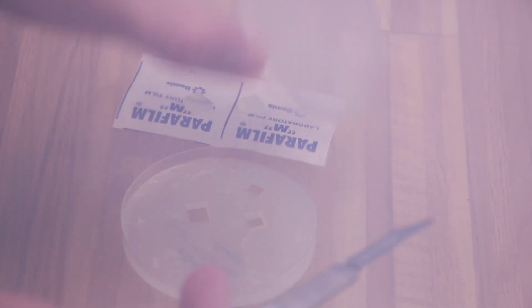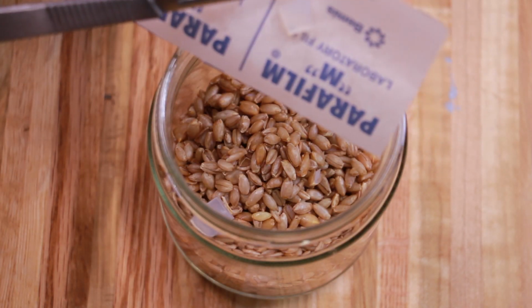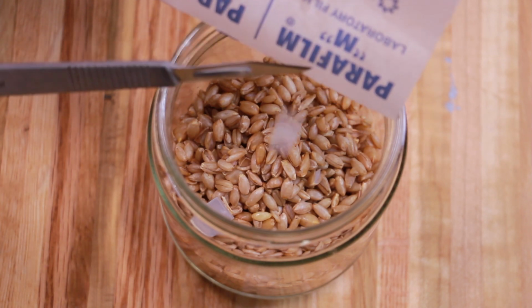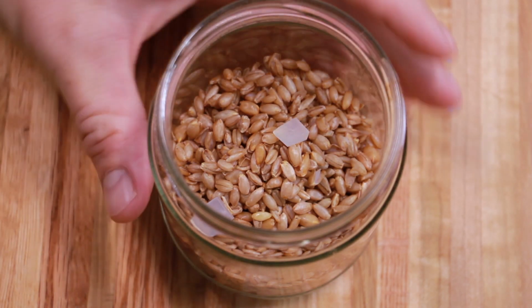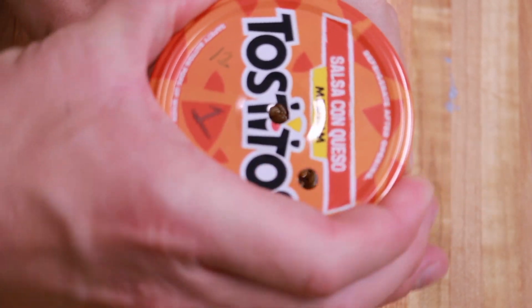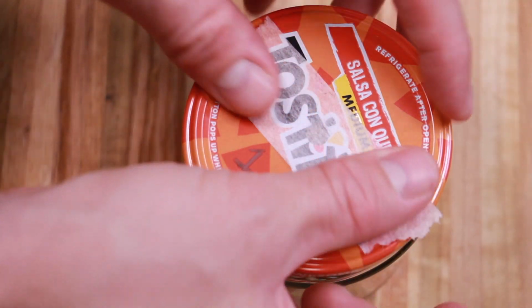And then in open air, I'm just scraping those 2 little chunks of agar into jar number 1 for the lacto ferment. I decided not to film this part of it, but I did the exact same procedure with jar number 2, except that one was fermented for 14 days instead of 10 days. I'll talk about results of that in just a second here.